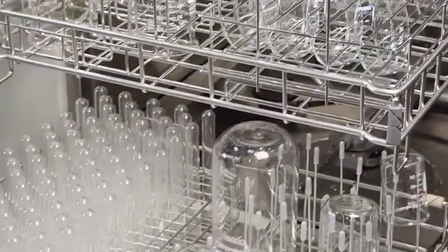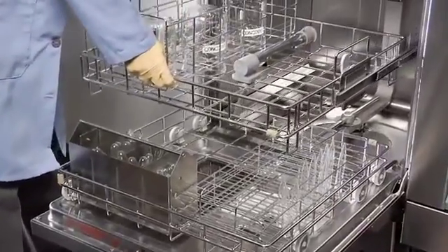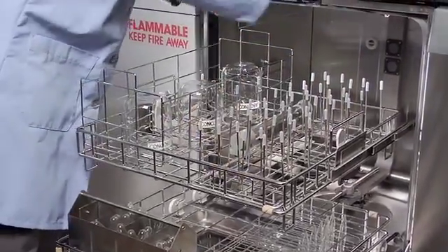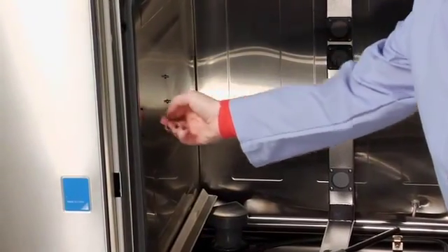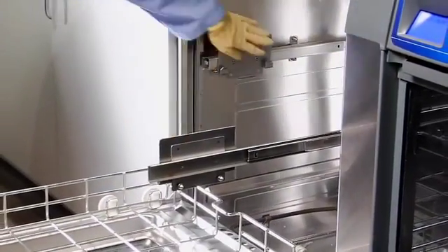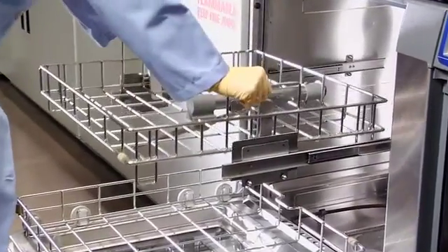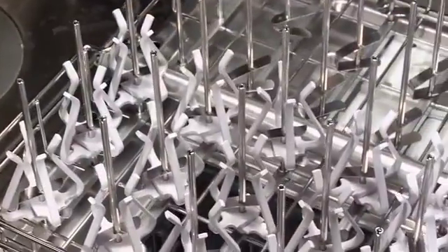The Steam Scrubber is designed to accommodate a variety of accessory inserts. Except for the smaller utensil basket, a maximum of two inserts fit in each rack. Most inserts fit into the top and bottom racks. Two rows of rollers allow placement of the upper rack in two positions to accommodate various glassware heights. To replace the upper rack after loading, first slide each rail all the way out, position the rack on the rails, press down, and the latch will automatically engage the rails.